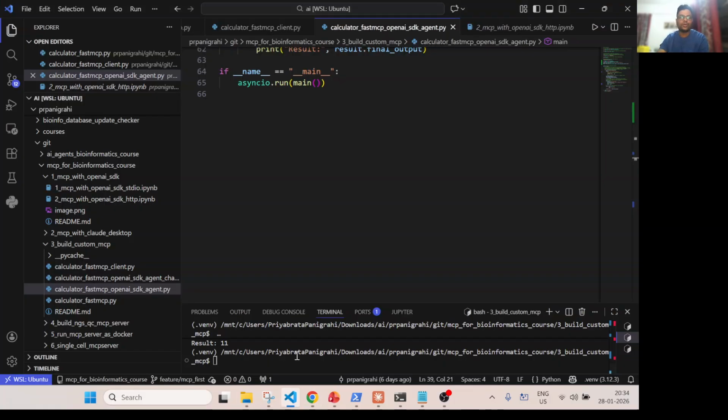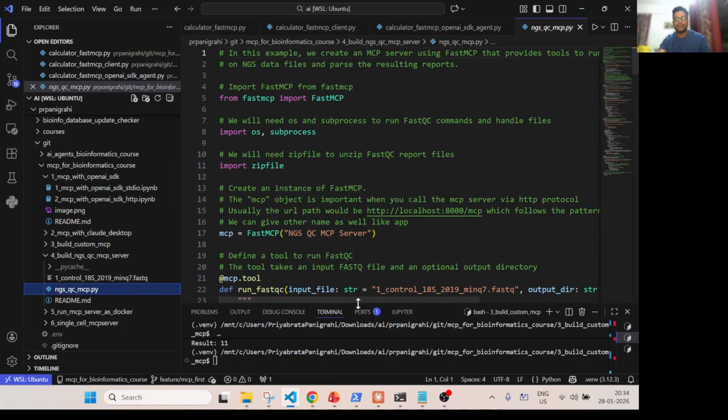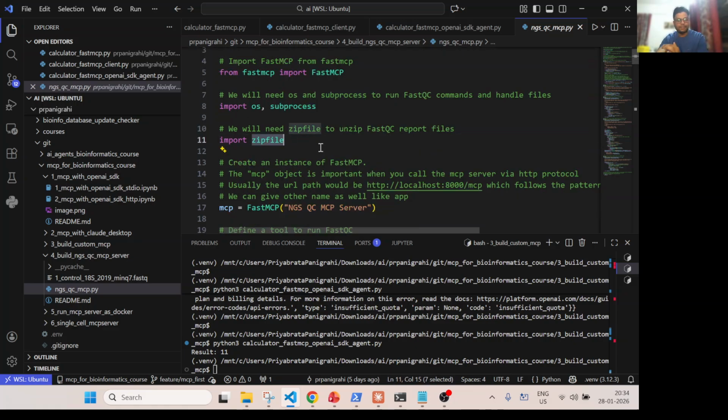So let's go to the code directly. This is my simple Python script, and I'll go through it one by one. First, we need FastMCP to build the MCP server, so we imported that. Then I import os and subprocess. Subprocess is needed to run FastQC, and I have imported zipfile to unzip the output.